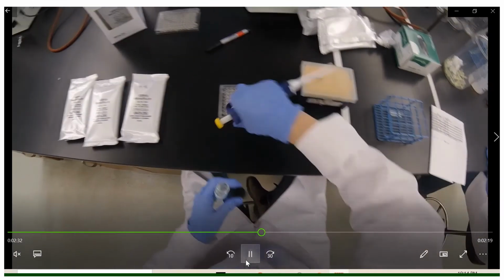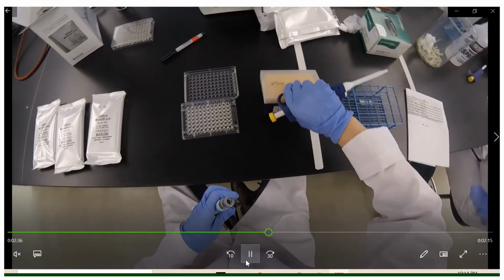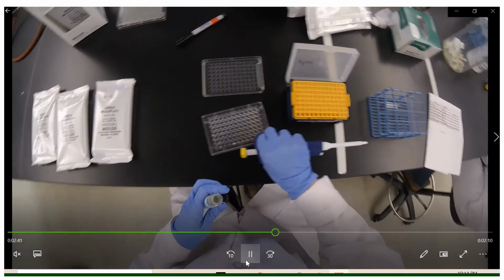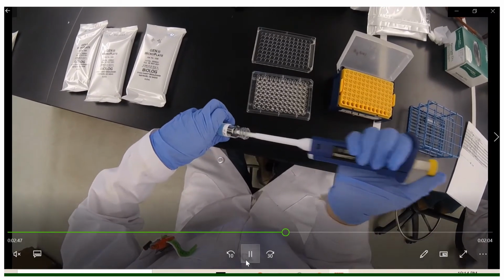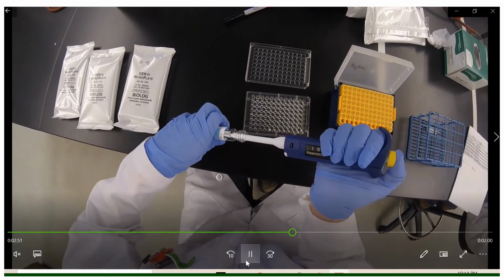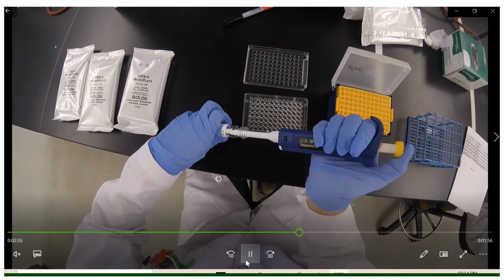When we're pipetting a solution such as this, we need to make sure that the white part of our pipette is completely sterilized with ethanol because we're going to be inserting the length of the pipette into the tube, which is something we normally try to avoid. Going down to the first stop on our pipette plunger, we'll put the tip in and then release the plunger to lift up the solution into the tip.